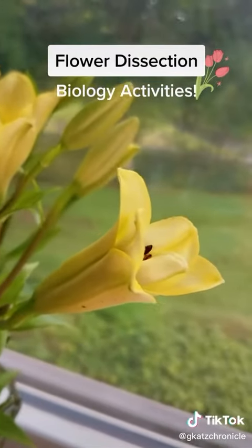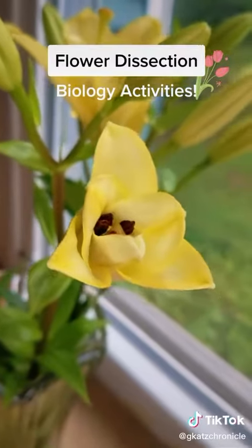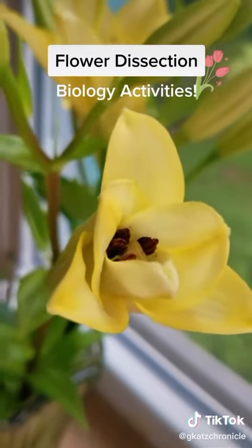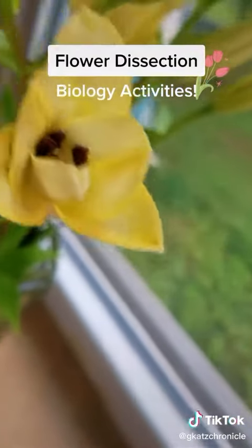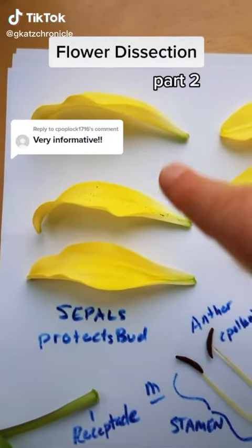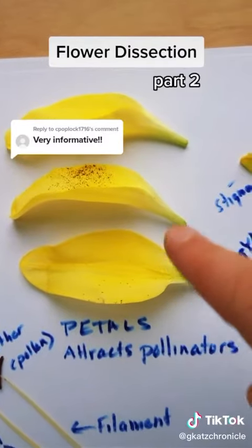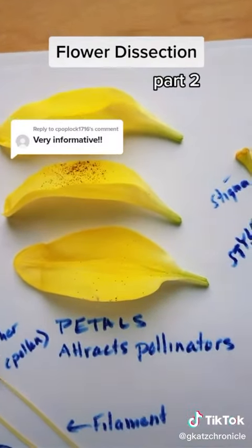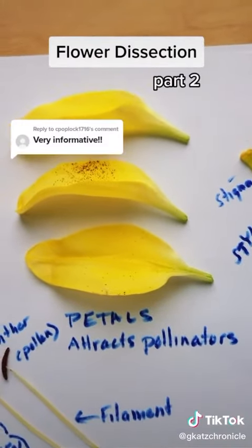And you can see the 3 sepals on the outside and the 3 petals inside, and you can even see some of the stamen and maybe the pistil a little bit on the inside. Here are the sepals, which protect the bud, and the petals, which attract the pollinators. There's some pollen grains on one of the petals there. The flowers are angiosperms, and many of them are hermaphrodites, so they have male and female reproductive structures.